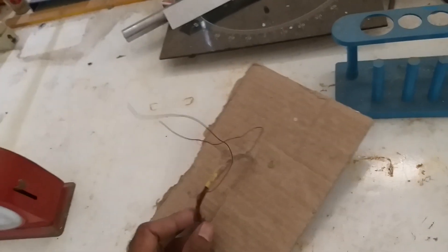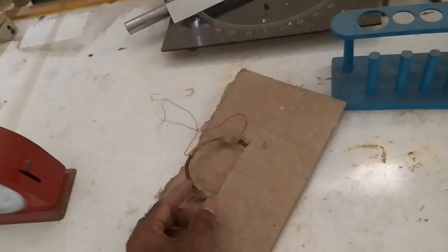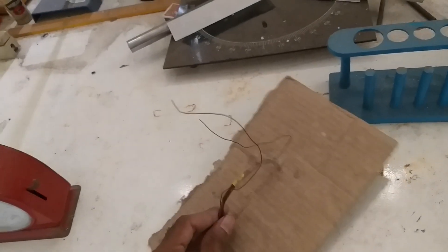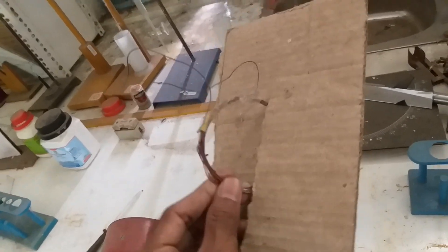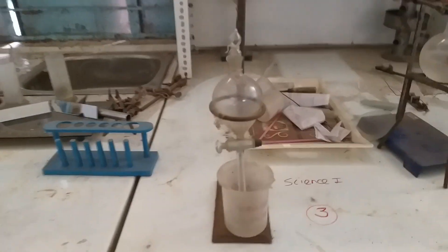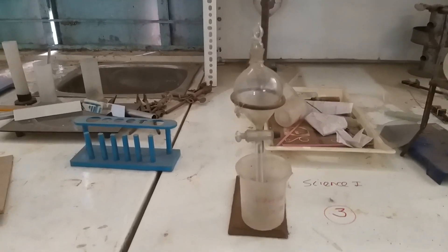This is a copper coil demonstrating the magnetic effect of electric current. Observe that this is actually a solenoid or coil. This is the apparatus for the separating funnel.